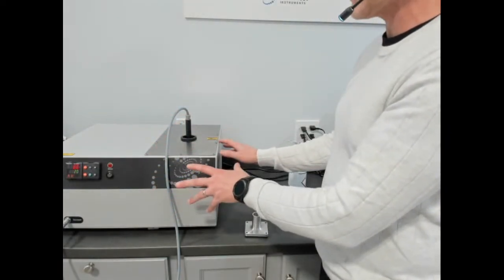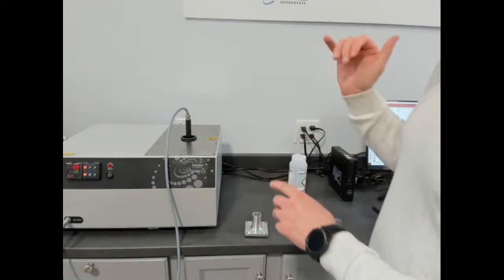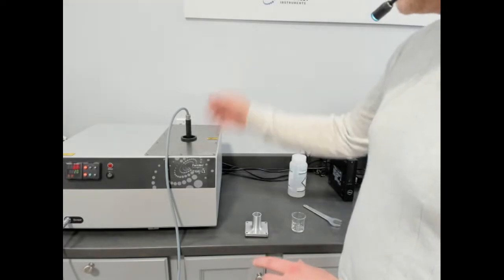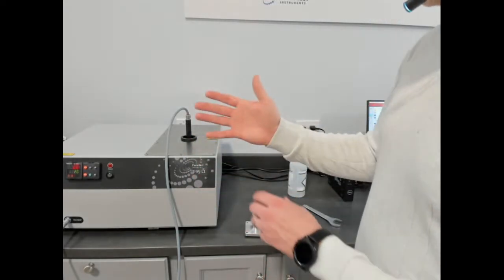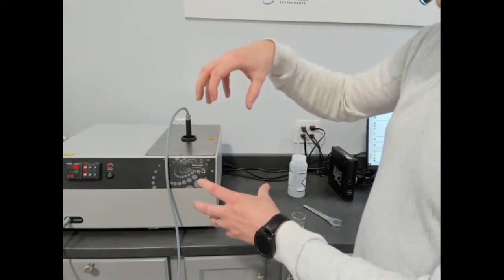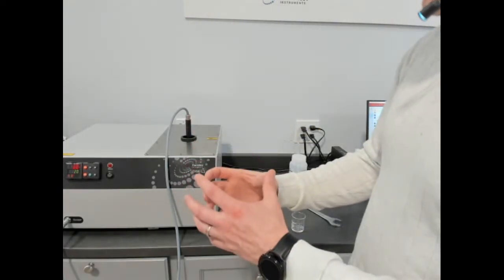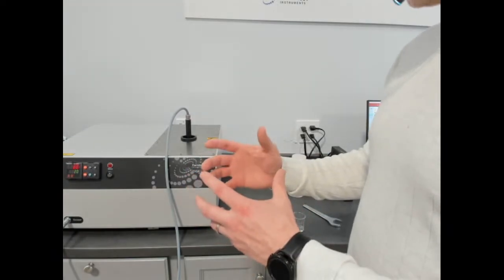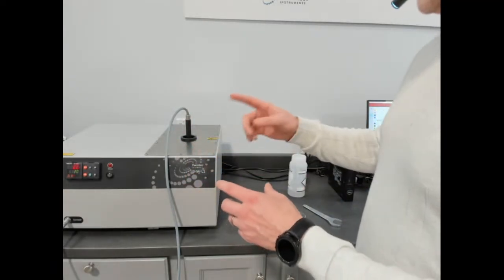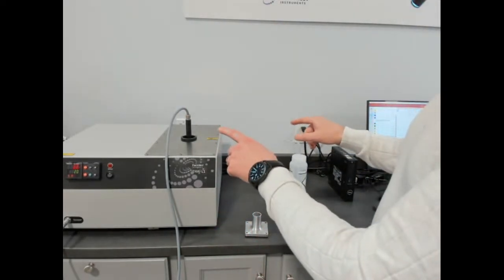What's really interesting about the way we control temperature, which is common to our THW as well as our MP1 series temperature platforms, is that it has integrated cooling and heating. If we were to cut this open and show you a cross-section, you would see opposing temperatures. The sensor is sitting inside of a heated well with a gap in spacing between the heated well and the cooling dimensions around it. That allows us to precisely control temperature. There's always cold and always heat opposing each other, so we get very good control of temperature. And it allows us to go from cold to hot without switching to different cooling and heating apparatuses.